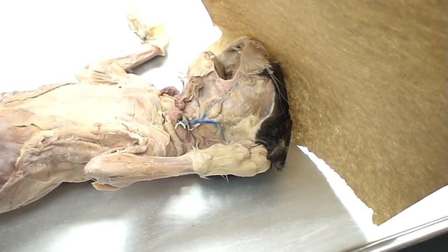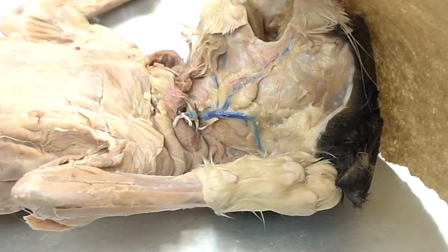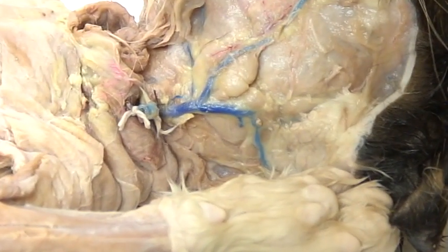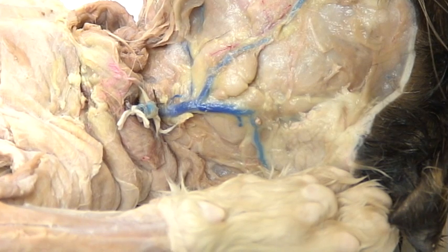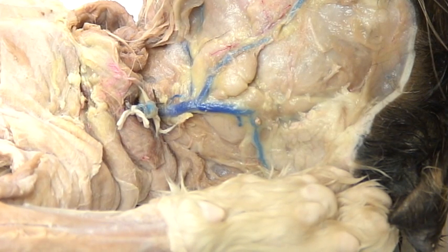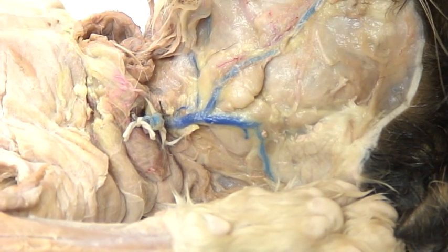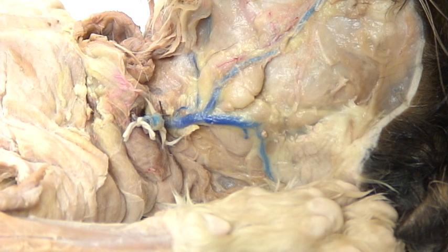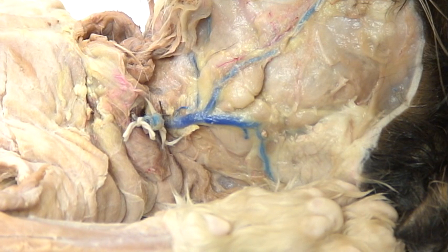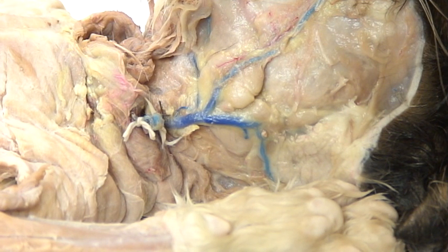One thing I want to point out is that these are exocrine glands, which means they have a specific duct that goes to the mouth, rather than an endocrine gland which releases its products into the bloodstream going to the entire body.